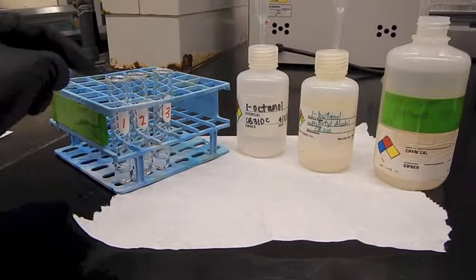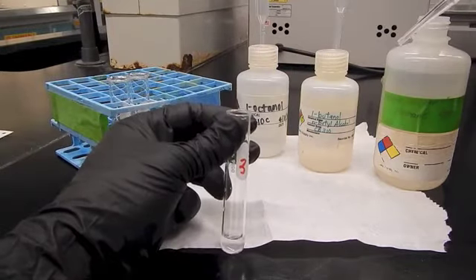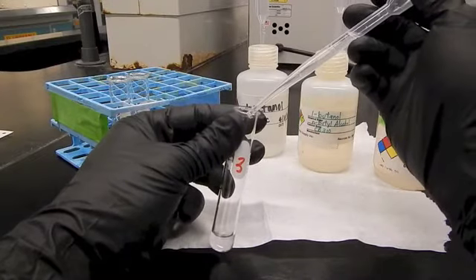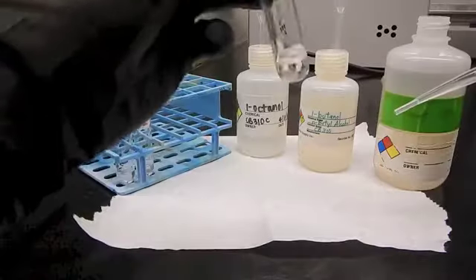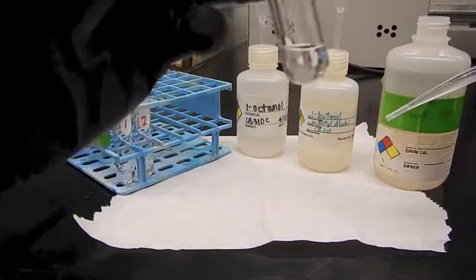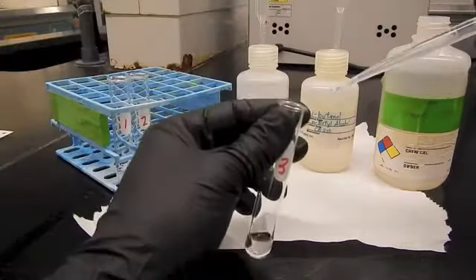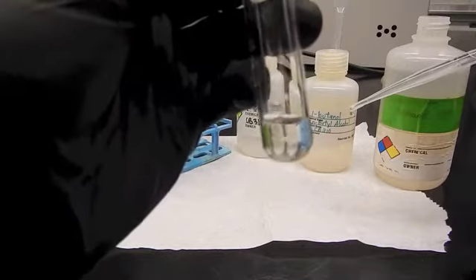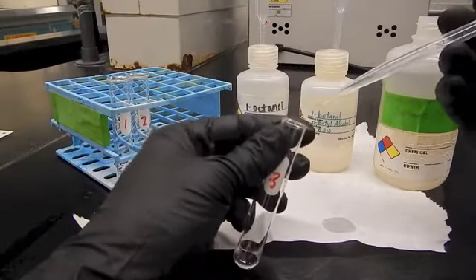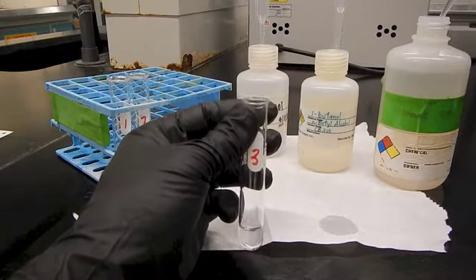And I've got my test tubes 1, 2, and 3, and I've already put 1 milliliter of water into each one of those. So now what I'm supposed to do is take my alcohol and add it 1 drop at a time and try to observe what happens when I add those drops. So I'm going to start with 3 drops. I'm going to shake it up a little bit, and I'm going to observe what I see in the test tube. So far I don't see any change. They look like they're mixing together. So I'll add 3 more drops and observe. So again, I don't see any change, and I'm going to continue doing this until I've added 20 drops total, and at that point we're going to stop adding drops.